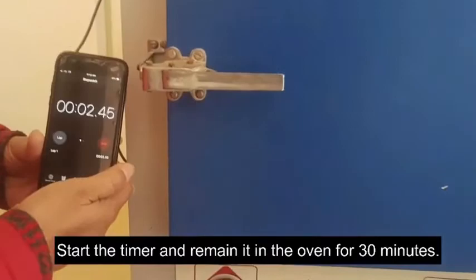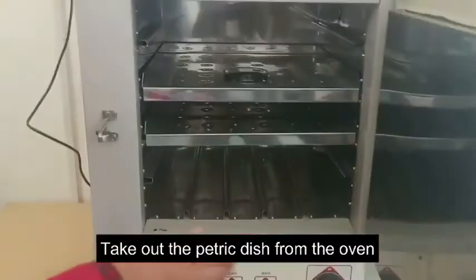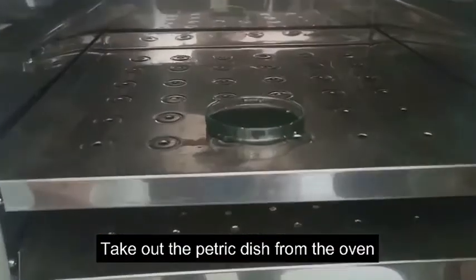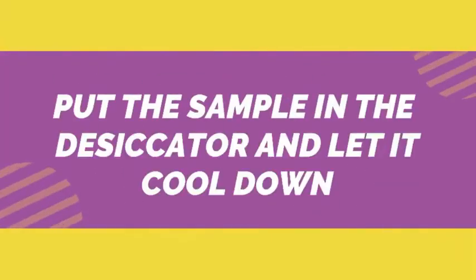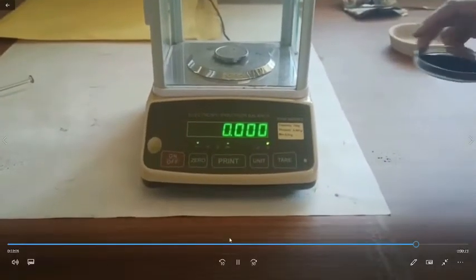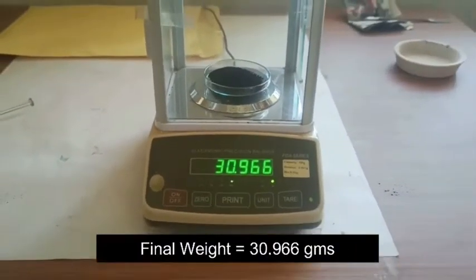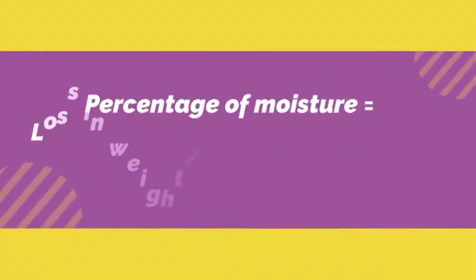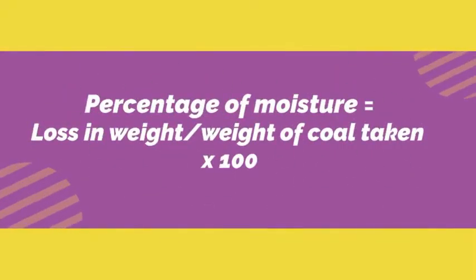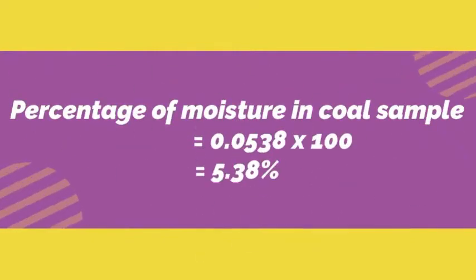We leave it for half an hour. Now we will allow it to cool for half an hour again after switching off the hot air oven, and then we will keep it in the desiccator. Then we are going to measure the weight again. Here I now have the weight of the petri dish with the coal sample — that is why I didn't tare previously. Now we are going to measure the percentage, and here are the readings.